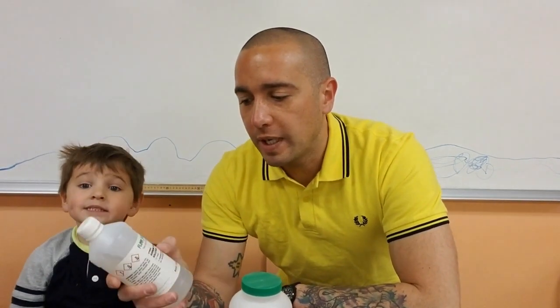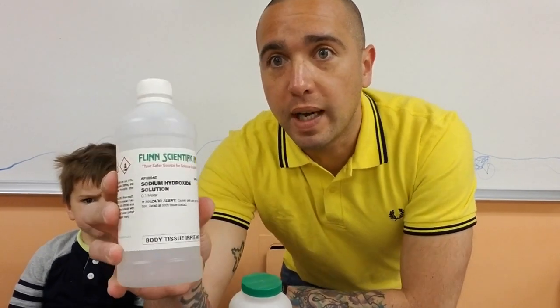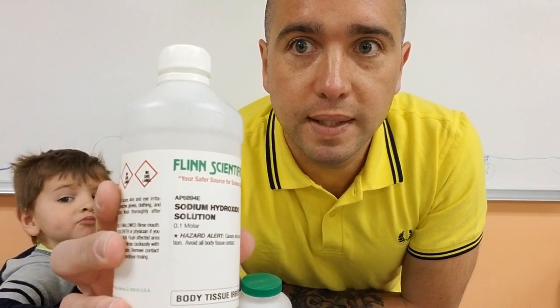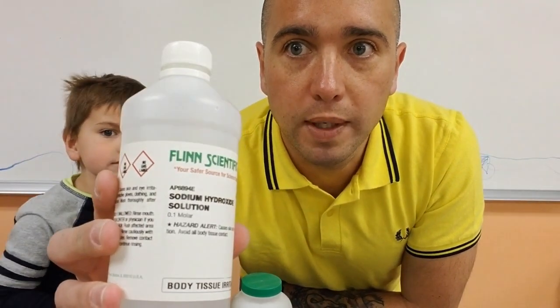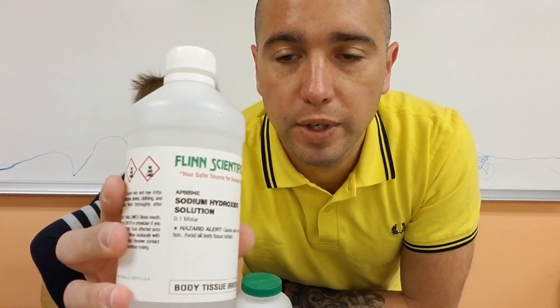Hey chemistry super fans. Today we're going to be doing another type of titration. This time we're going to be trying to figure out the concentration of this bottle of sodium hydroxide. We got it from the supply company and it says it's only approximately 0.1 molar for its concentration.